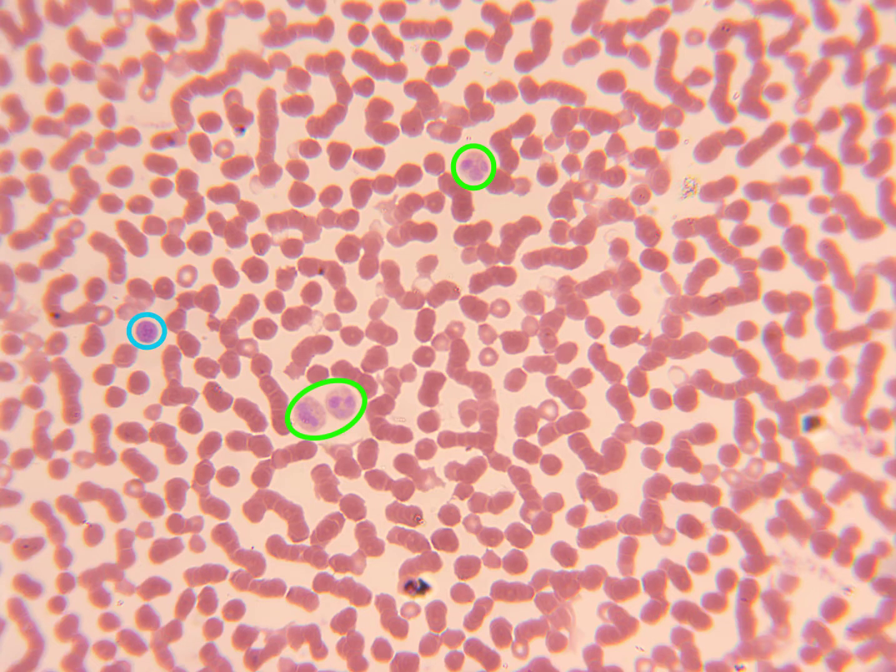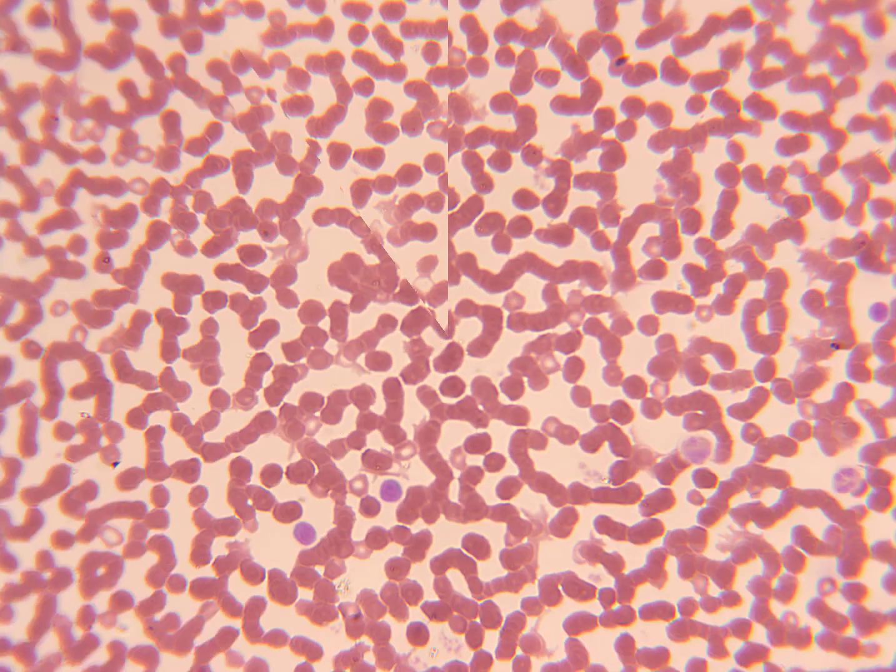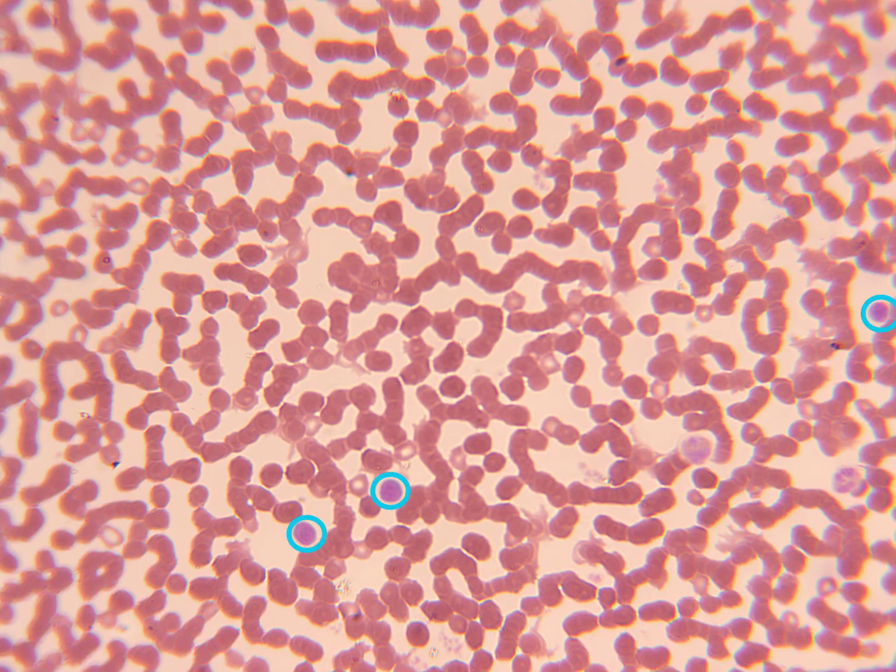And while the lymphocyte's cytoplasm stains darkly on this slide, you can still see that big round nucleus that takes up most of the space inside the cell. So it still looks like that big eye looking at you. Here we see more lymphocytes as well as more neutrophils.